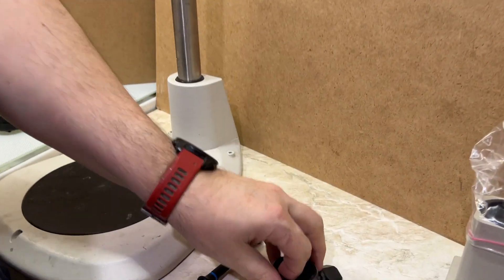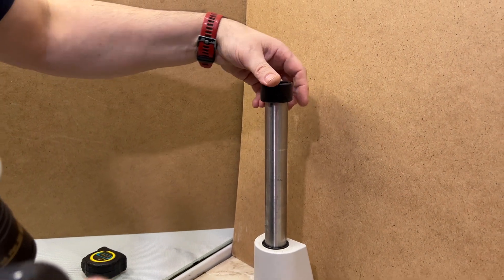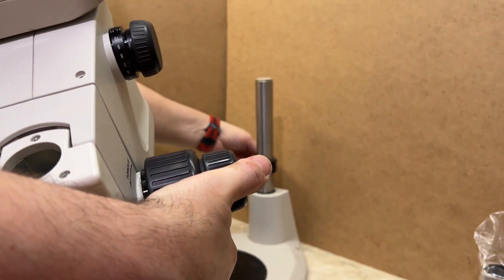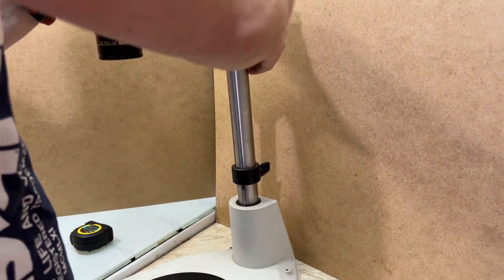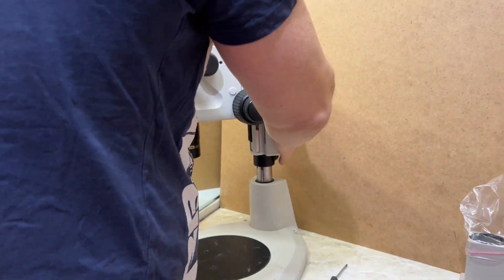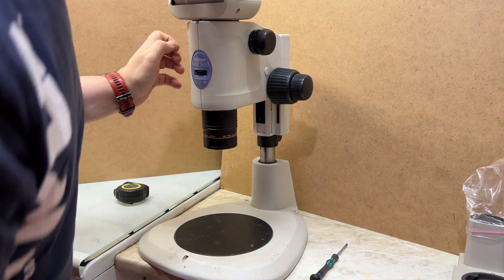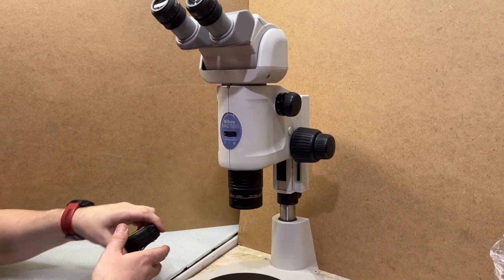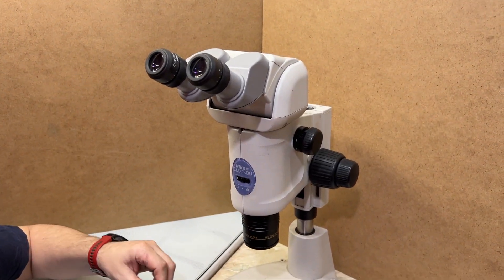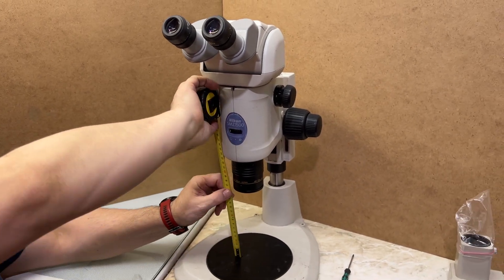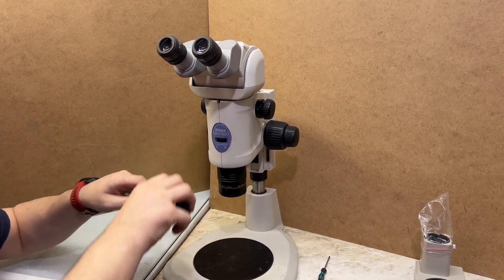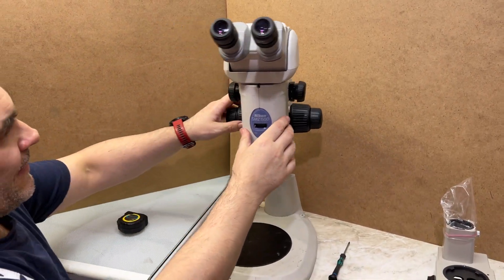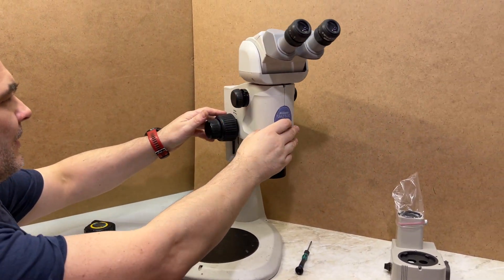This ring puts the whole system on other heights. Now I'm trying to put it as high as possible with this short stand. We can see that now the working distance turns to be about 17 centimeters. Not that bad.